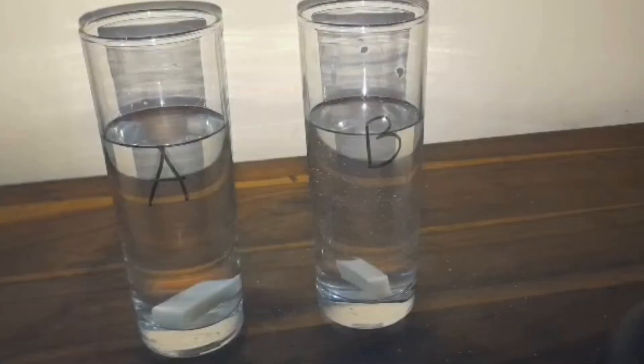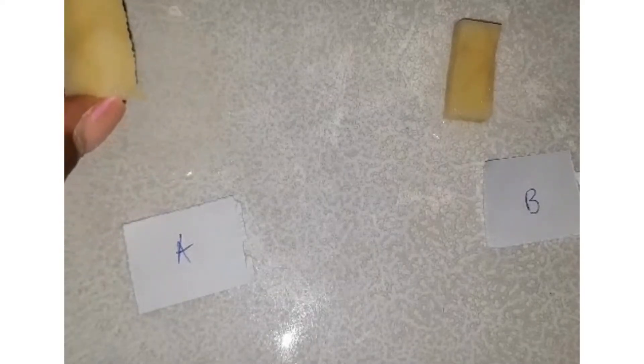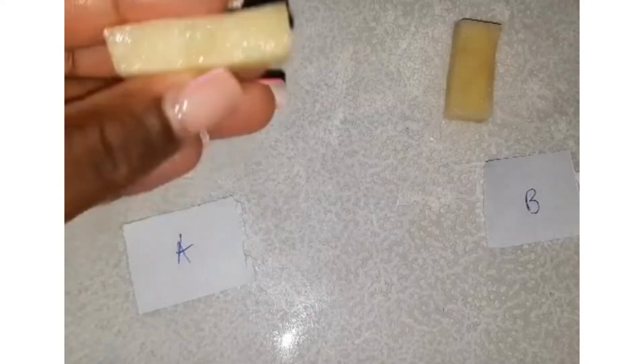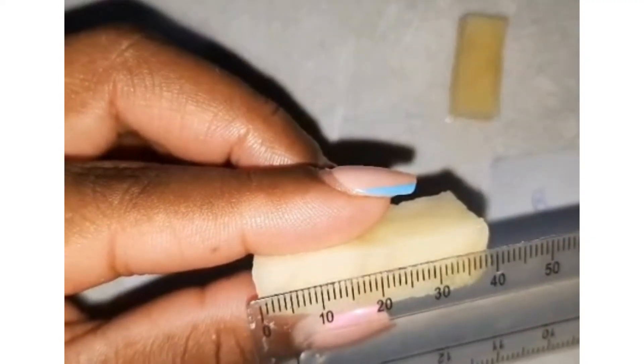All right, the time is up. Let's see what happened to our potato pieces. Now let's measure the potato pieces again and compare the initial and final dimensions.